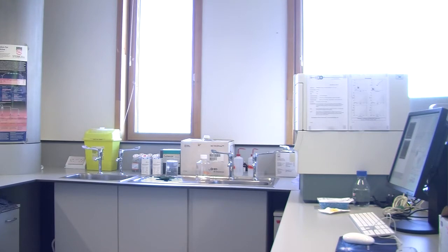Unfortunately, you see a lot of modern PhD students nowadays, because there are so many kits out there, they buy the kit, they run the protocol in the kit, and the data has to be right, doesn't it? Because they run the protocol. But when I was in the lab as a PhD student, and generally as a postdoc, there weren't many kits. You developed your own assays with your own reagents you bought. So you had to prep everything. You knew why you did every step because you invented it. If you're given a predetermined protocol, it's harder to know why you're doing it because you're just told to do this.